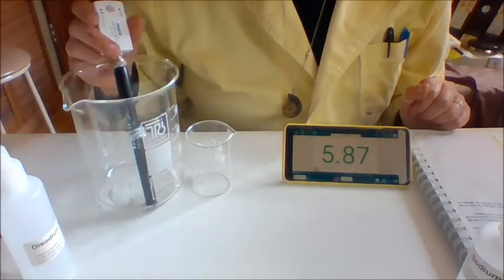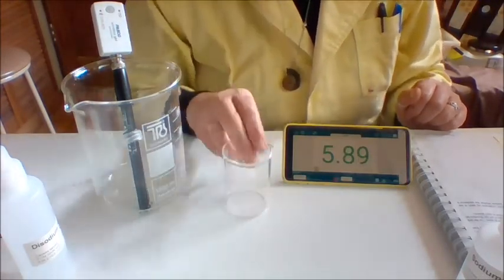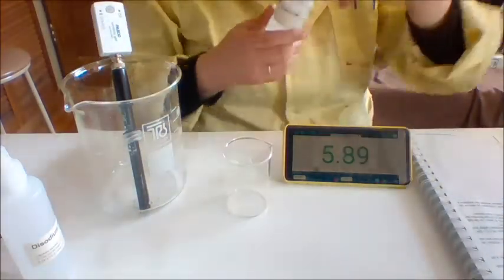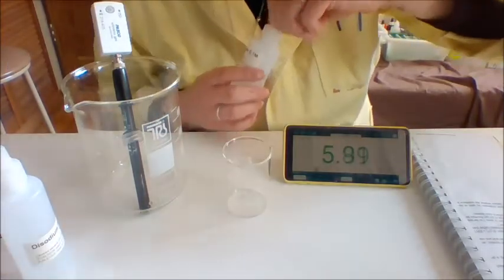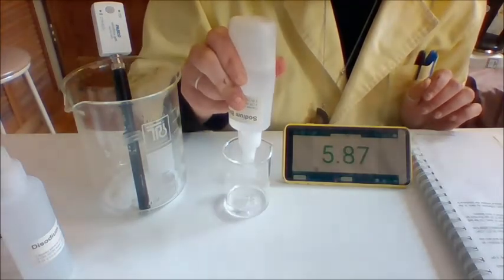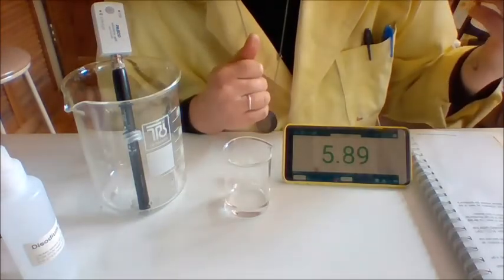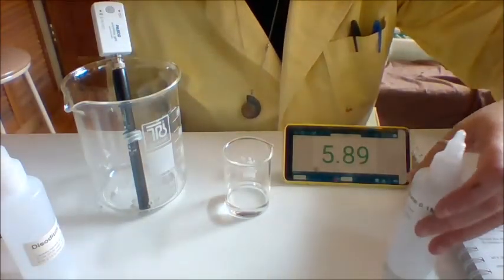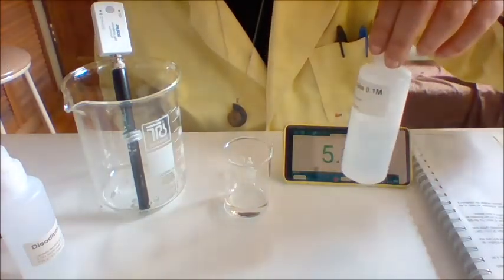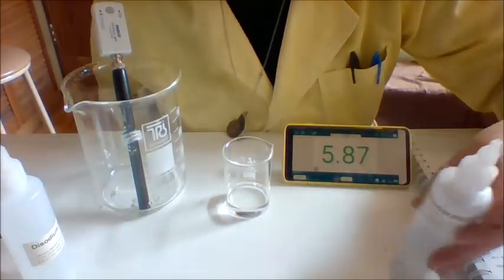Okay, I have my pH meter here, and the pH reading is here. So I'm just going to go through them and test the pH, and you can write them down, and then you can hypothesize what that means. So the first one we're going to test is sodium bicarb, which is crazy that it's amphiprotic because you always assume that sodium bicarb is just basic. Anyway, all of the solutions are 0.1 molar. That's why I'm not wearing gloves, because I don't like to waste things, and these are dilute solutions.